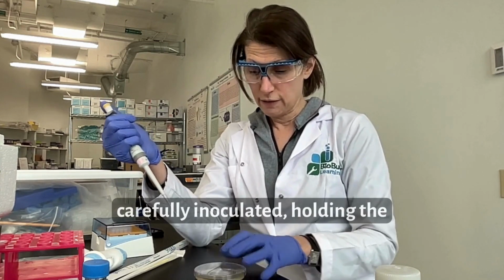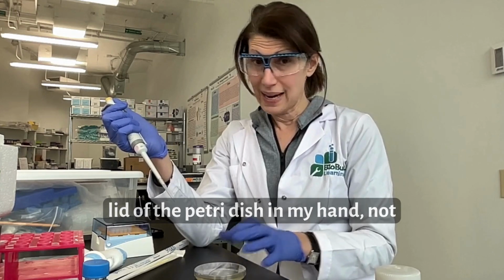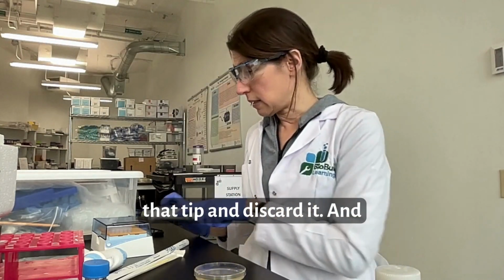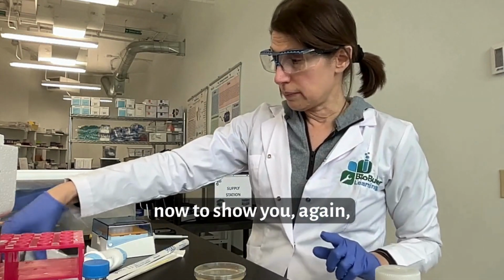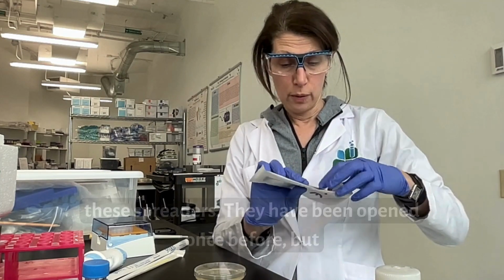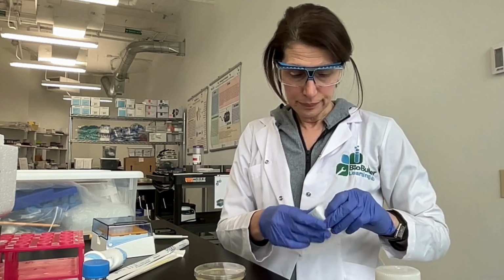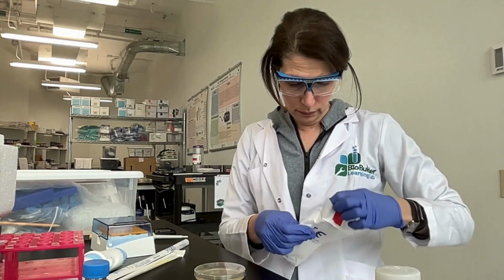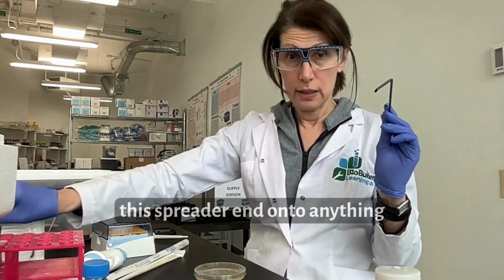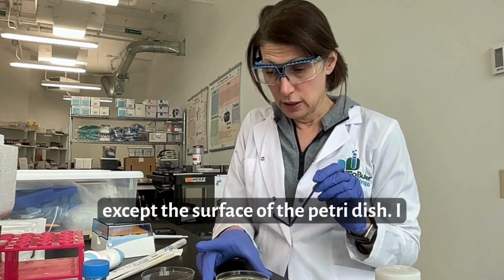So I've just carefully inoculated, holding the lid of the Petri dish in my hand, not putting it down on the table. I will remove that tip and discard it. And now to show you, again, these spreaders, they have been opened once before, but I will take out one. And not touch this spreader end onto anything except the surface of the Petri dish.